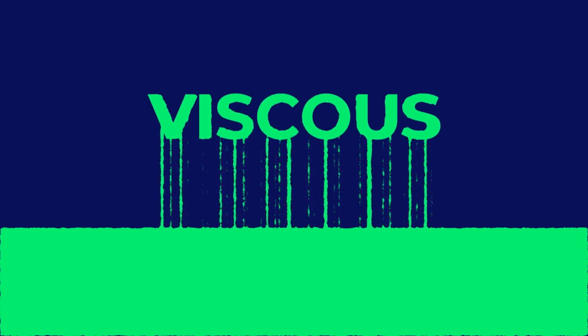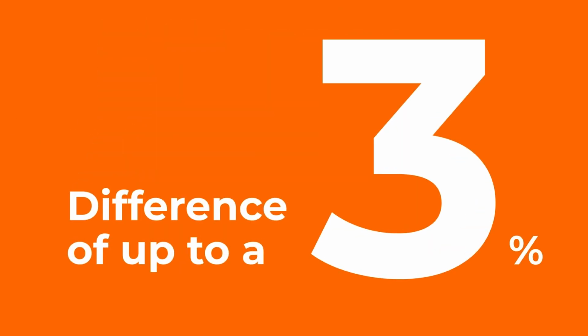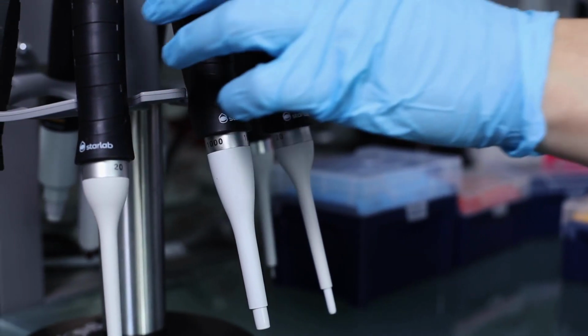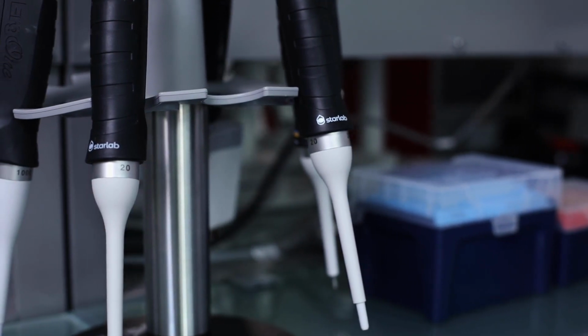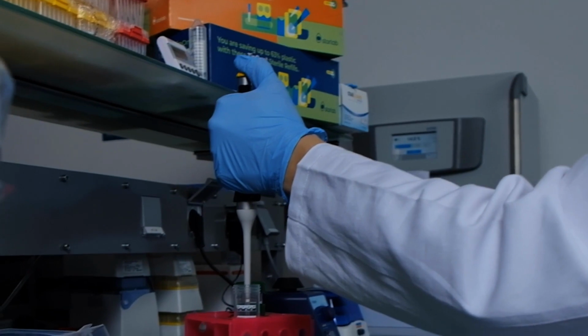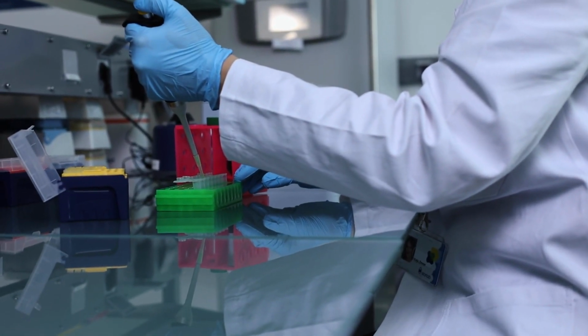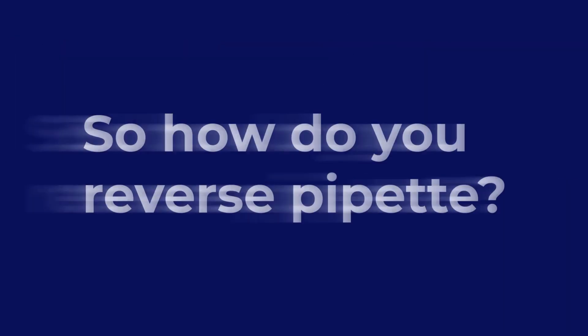For samples that are either viscous, foamy, or volatile, I recommend using me in reverse mode. Did you know there's a difference of up to 3% error associated with using a pipette in a different mode to which it has been calibrated? So if you regularly pipette in reverse mode, make sure you have a pipette that is being calibrated in reverse mode in the lab. So how do you reverse pipette? Follow along, it's easy.